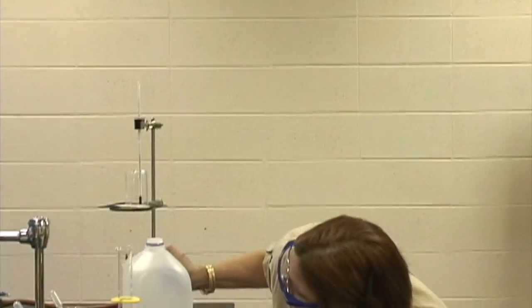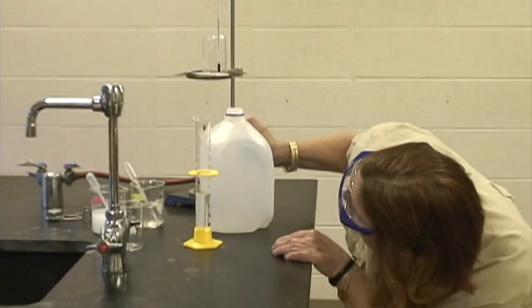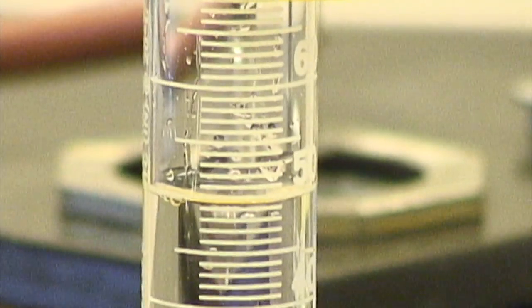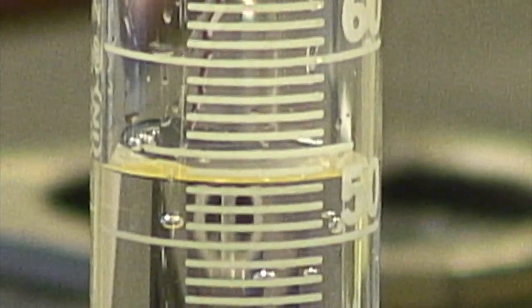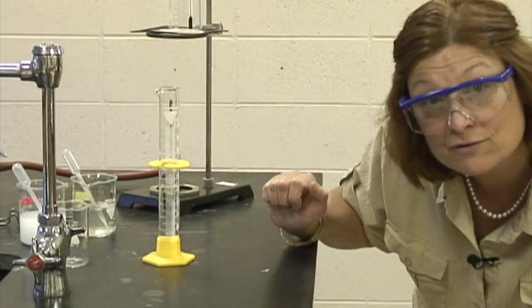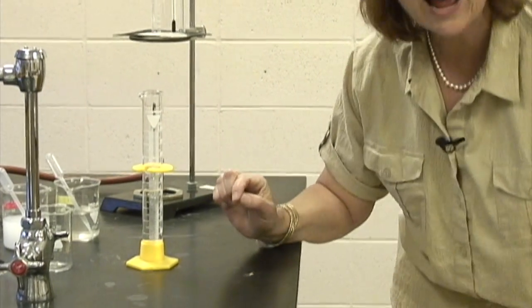And I want the bottom of the meniscus to be on the line. Now, this is also a source of error because of the position at which I look at it. We sometimes have what is called parallax, when the eye level is not right on. And when we look at numbers, and I'm sure you've noticed this in labs before, I think it's one volume and you think it's another volume.